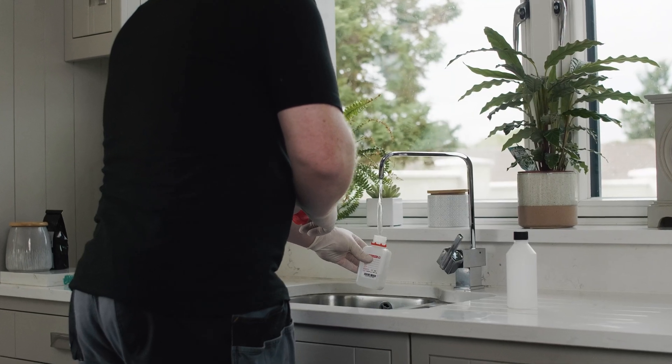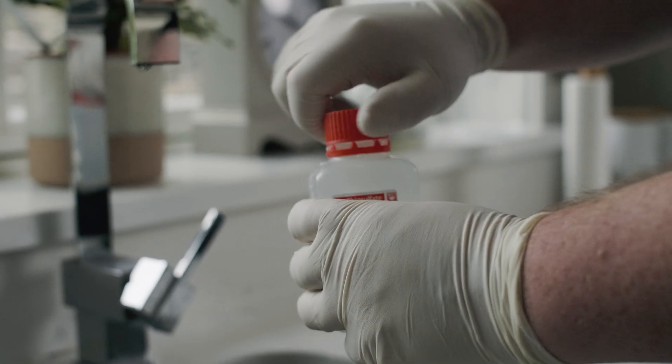Hi, I'm Daniel O'Leary, a field technician here at Southern Scientific Services. Today I'm going to guide you through the process of taking a drinking water sample at your home.